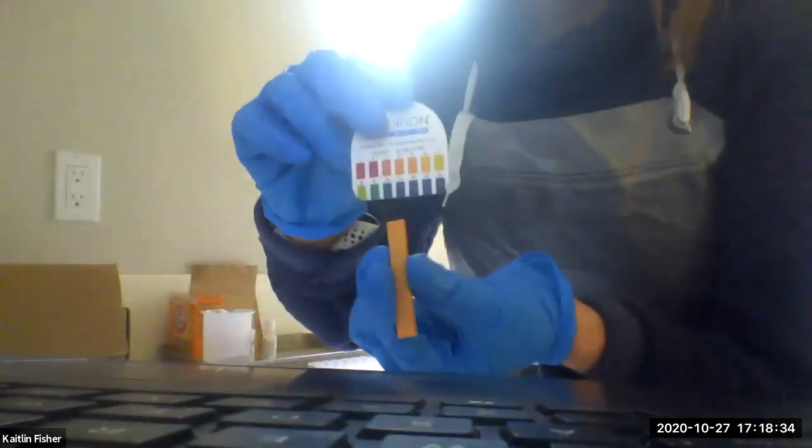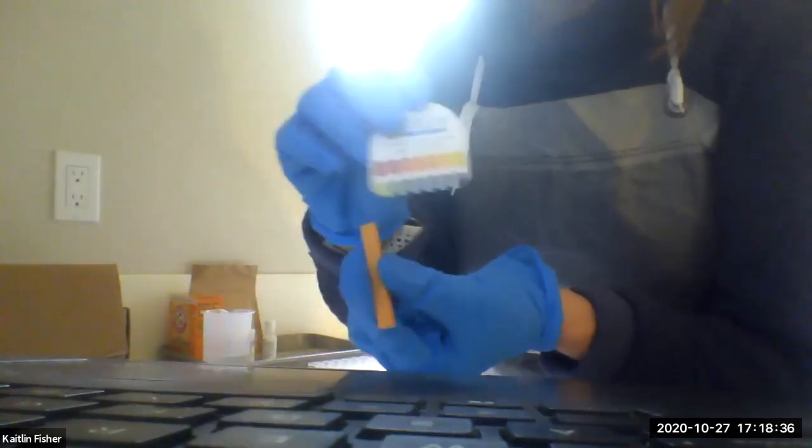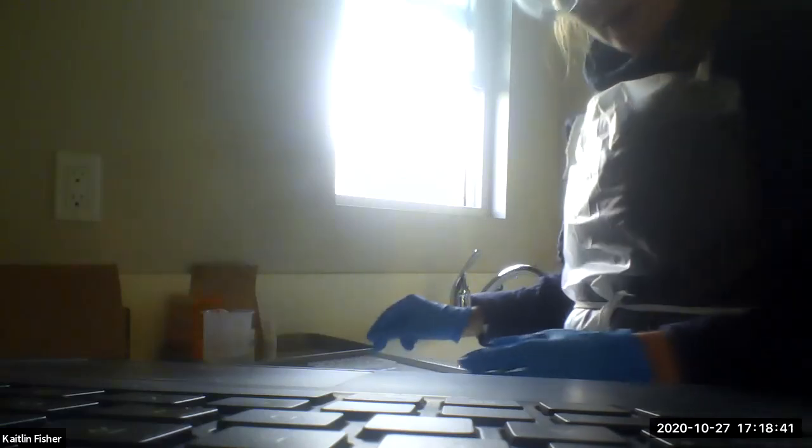Along with that, inside of the envelope, if you can get it out, which is always the tricky part, right? There we go. Inside of this envelope, you'll have a stack of pH paper. They start out as orange. What you do is dip them into your chemical reagents, and then hold it up to your pH chart, and whichever color it matches will give you the pH of your solution. So you're going to have your pH paper in front of you.